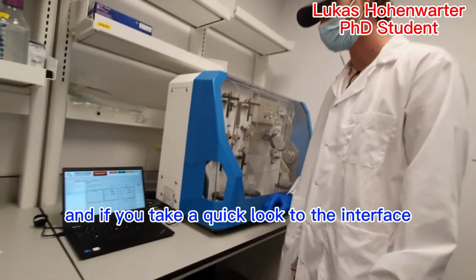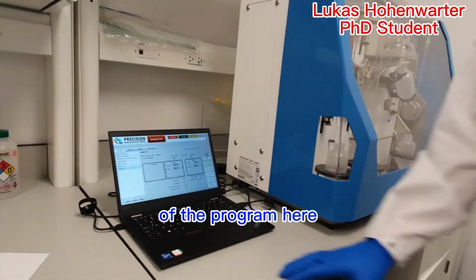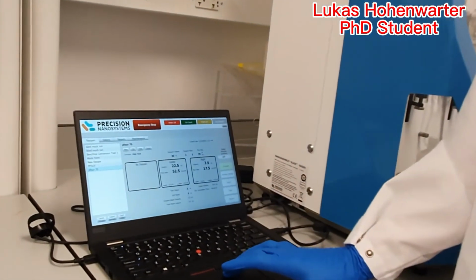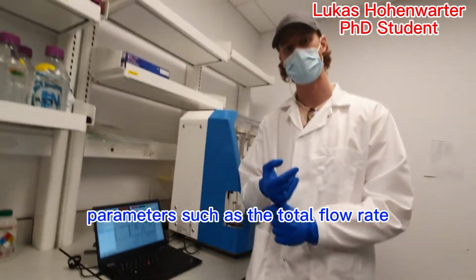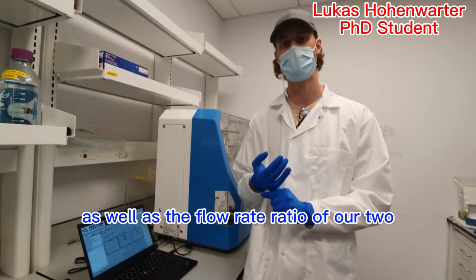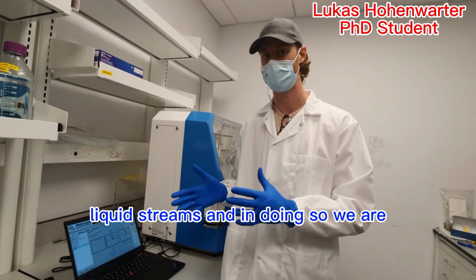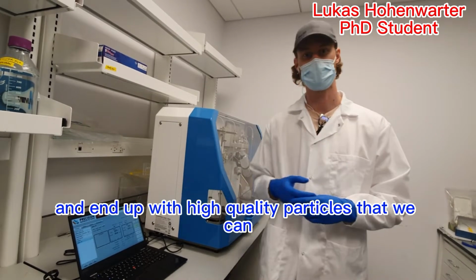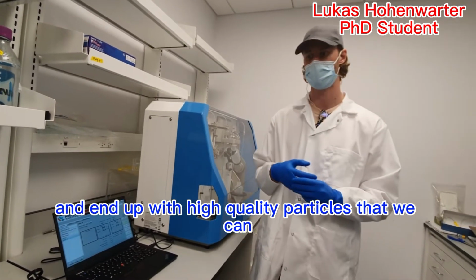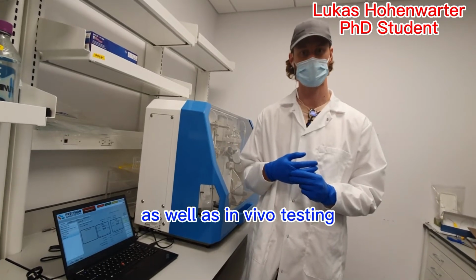If you take a quick look at the interface of the program here, we're able to control the production parameters such as the total flow rate as well as the flow rate ratio of our two liquid streams. In doing so, we're able to control the particle size and end up with high quality particles that we can use for in vitro as well as in vivo testing.